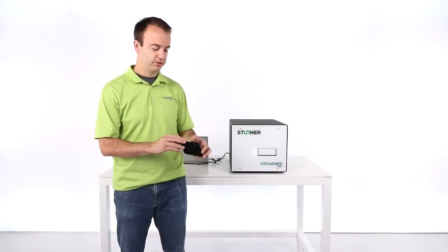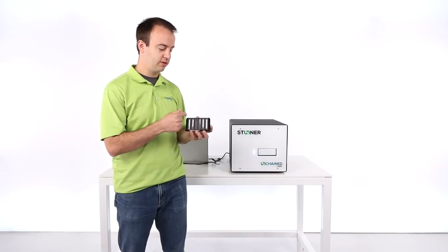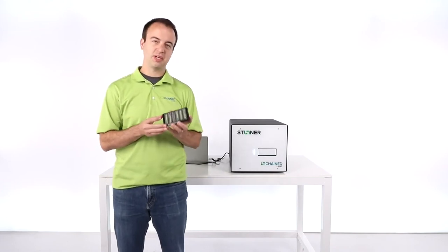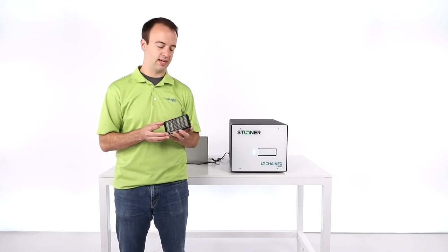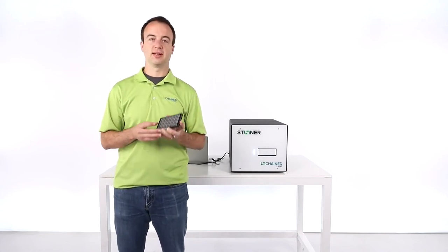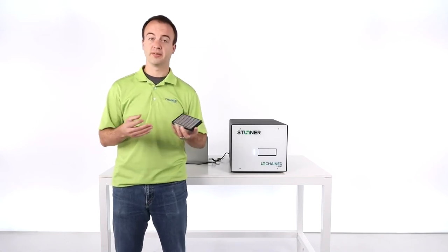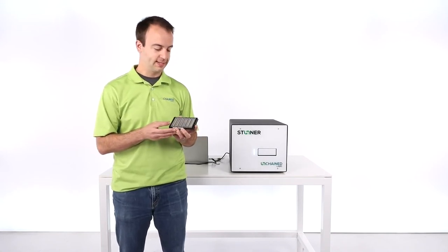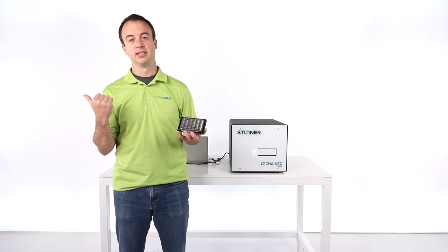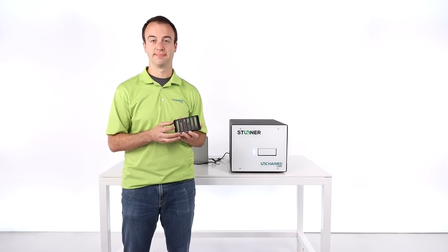So first, let me introduce you to the Stunner plate. This is a standard 8x12, 96-well plate format, and it's kind of the secret to how Stunner can do everything that it does so well. It's engineered for excellent accuracy and precision, both for UV-Vis and for DLS results. And to get to know it better, I think we're going to head over to the sample loading table, and I'll give you a close-up look at the Stunner consumable.